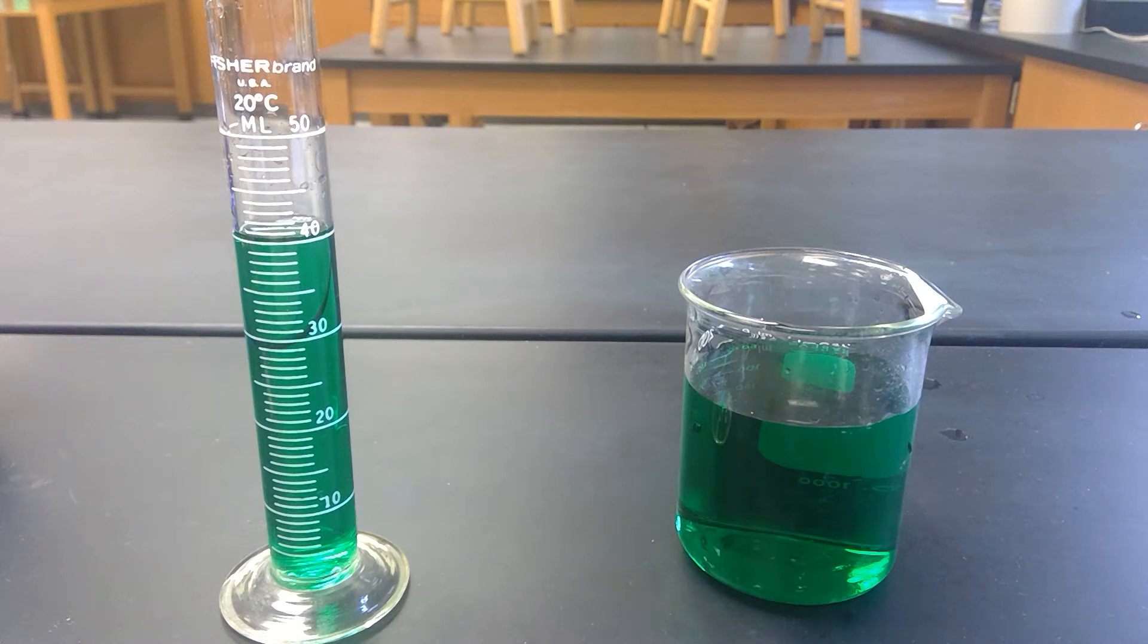This is station five, which is about adhesion and capillarity. Adhesion is a type of hydrogen bonding where water is going to be bonding to something other than other water molecules.